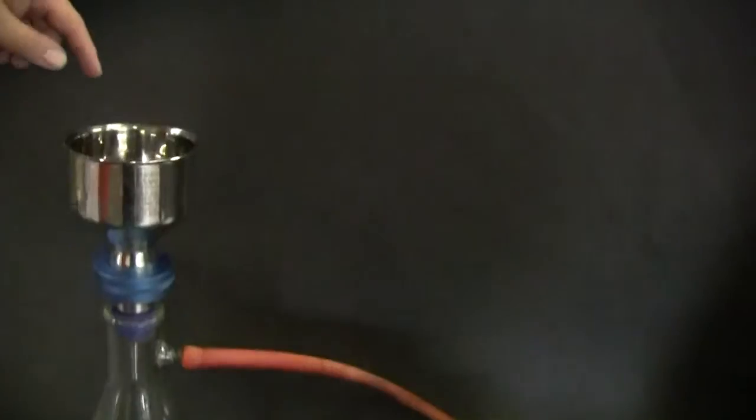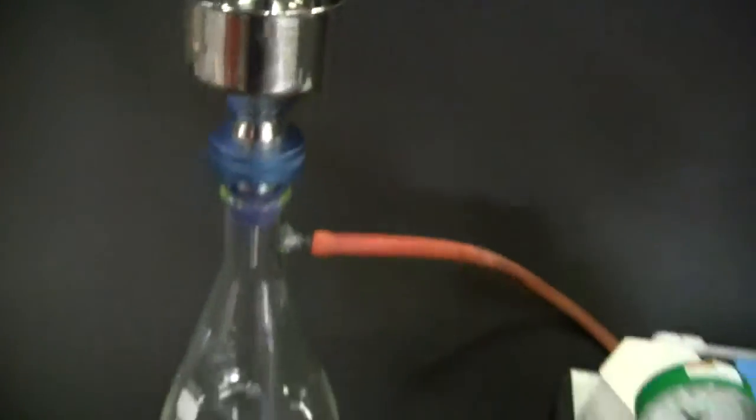Let me zoom in here so you can see what I'm doing. I'll just put the stopper in there to simulate a flow.